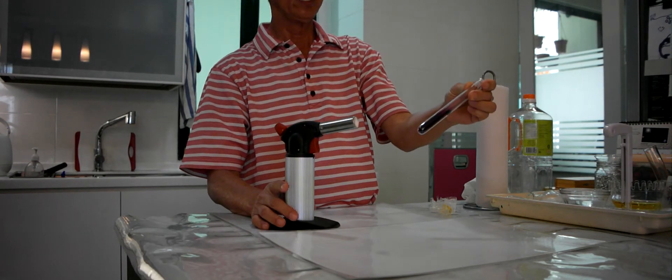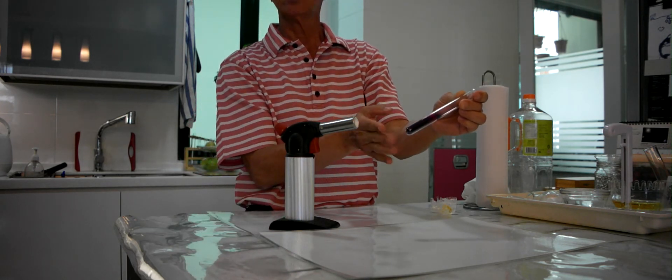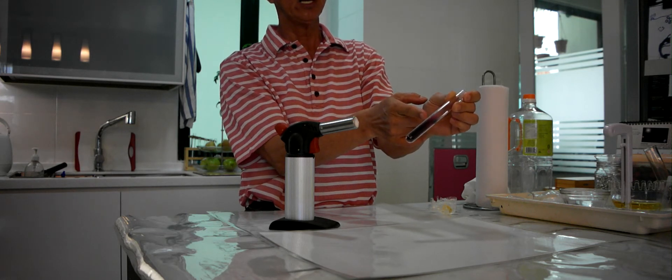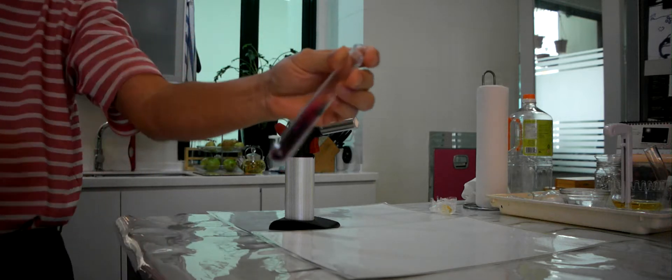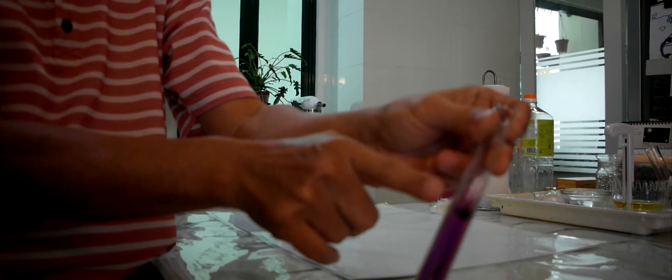So the iodine will sublime. And when this cools, the bottom will be white. And the sublimate here is the shiny iodine crystals. Can you see? Come here to see.